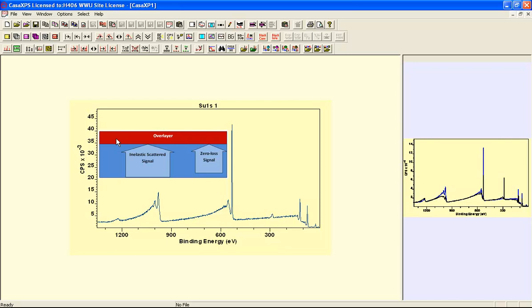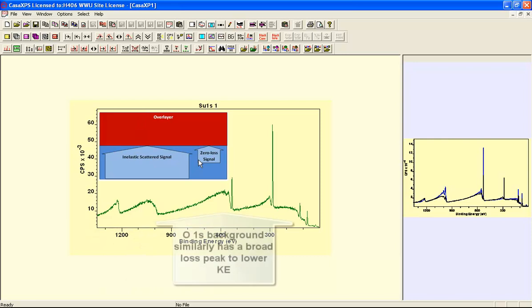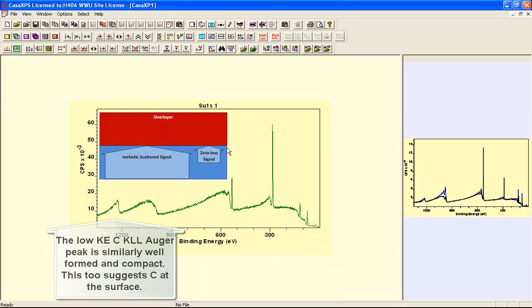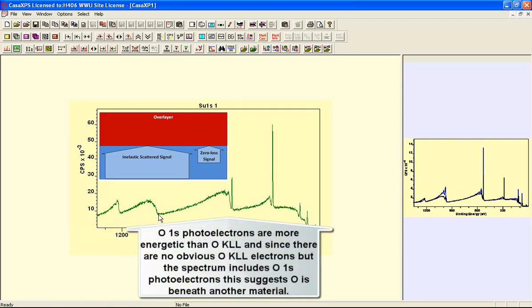surface. Now, if we contrast this with a sample where we've got a thick overlayer, so the material again of interest is the aluminium and the oxygen, then we see that we've got a well-formed carbon 1S peak and we have a well-formed carbon Auger peak. So these both together suggest that we have an overlayer that's mostly carbon, and the oxygen 1S compared to the oxygen Auger, where there are no peaks now showing at all.